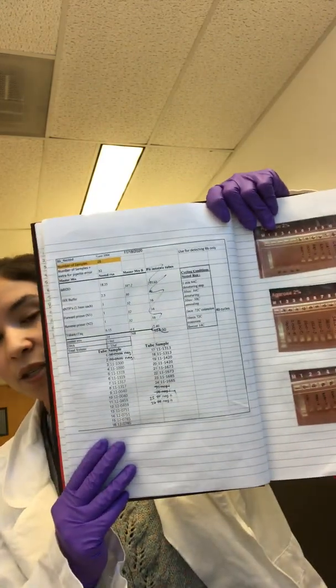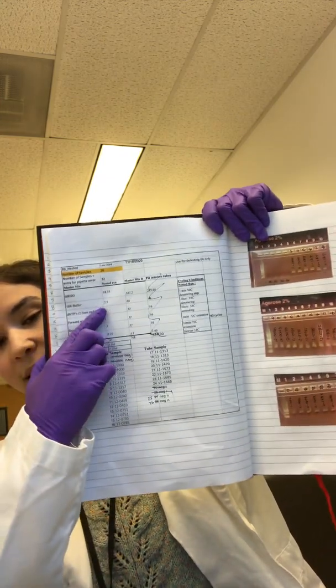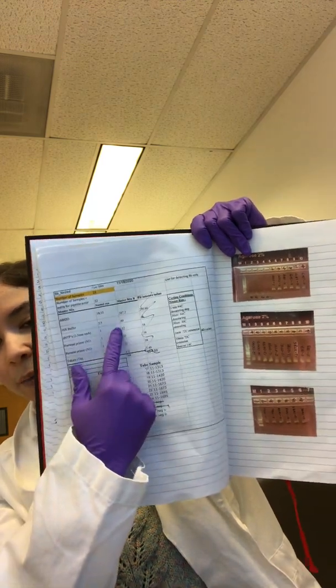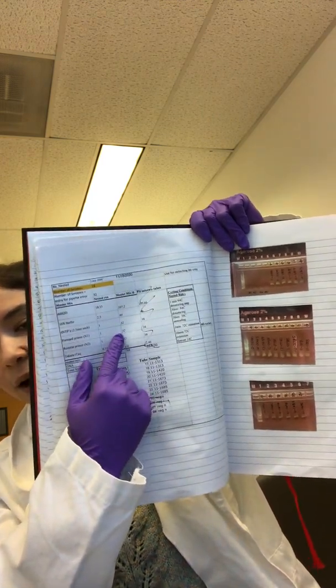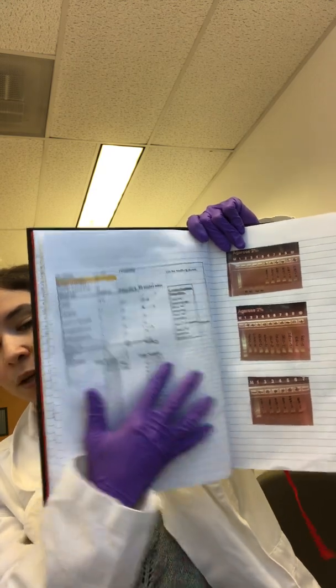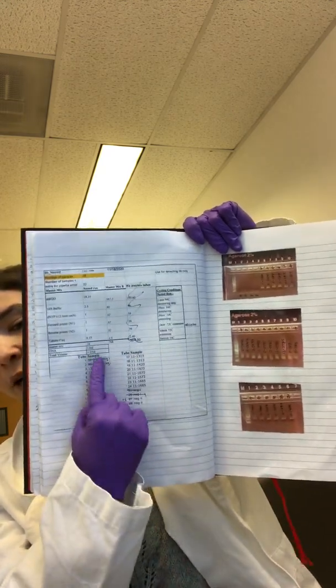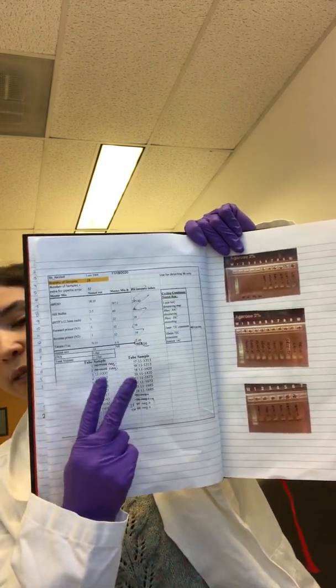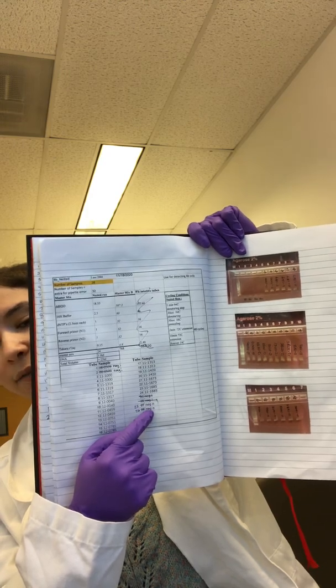So again, repeat the entire process. We're going to go in and make sure that we pull up the nested PCR template, so it says nested at the top. Another thing I like to make sure is dNTPs, forward and reverse primers, all of these quantities should be the same. So just eyeball that your equation worked and that everything autofilled to be the same down here. You're going to repeat all of your steps here, and you're going to put your tube numbers or whatever numbers you have. Plus you're going to add 2 more samples for 2 more negatives. So you should have 4 negatives at the end of the day: 2 initial and 2 nested.